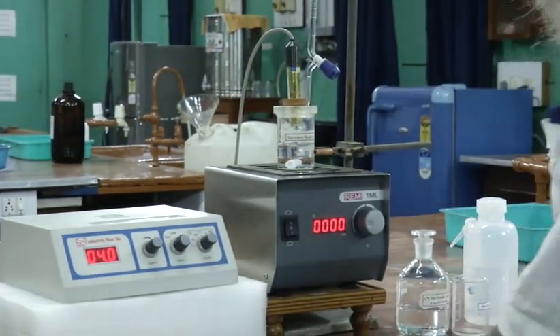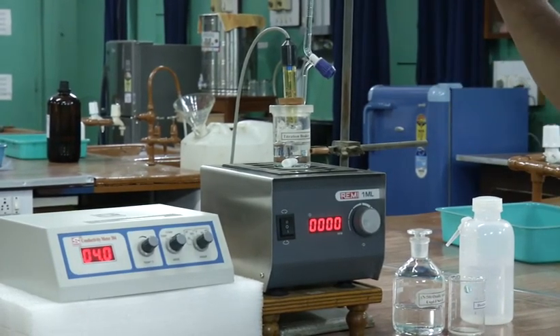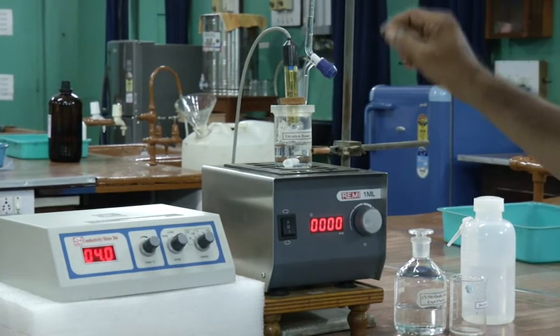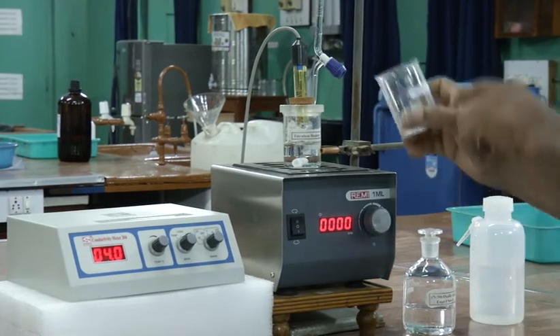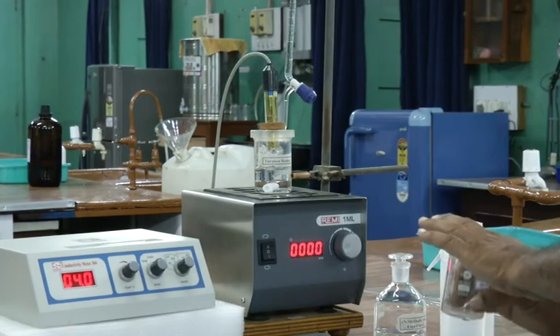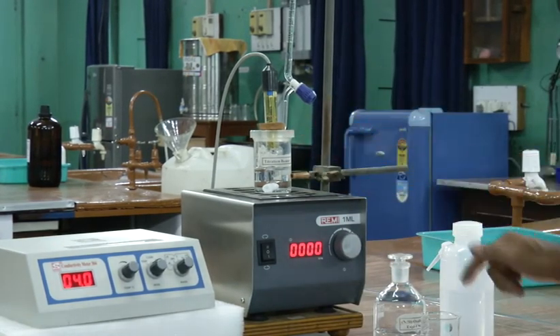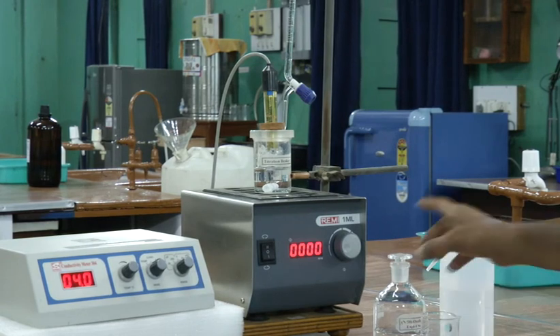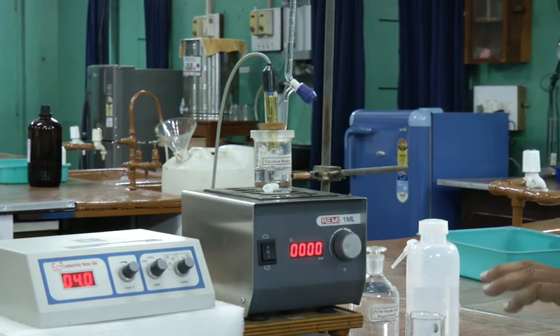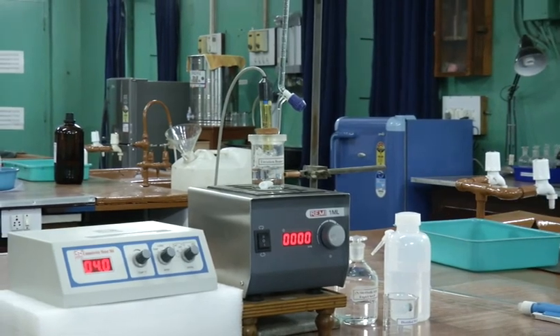After completing this, you have to wash all the beakers and the cell. Then you have to keep the cell in distilled water, not in alkaline medium. You have to throw that liquid out into the basin, then wash the beaker, keep the beaker here and keep the cell in distilled water. Do not forget to do this. So this is all about the experiment. Now, you can do the experiment. Thank you.